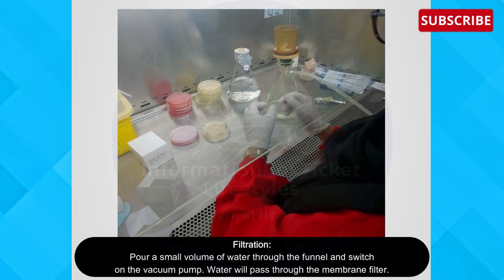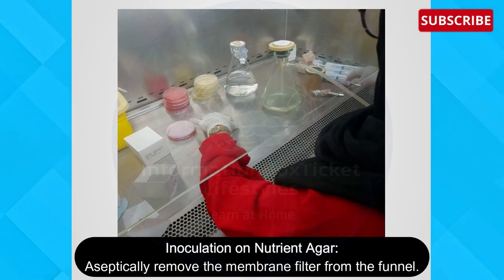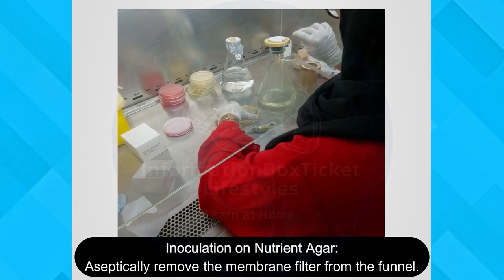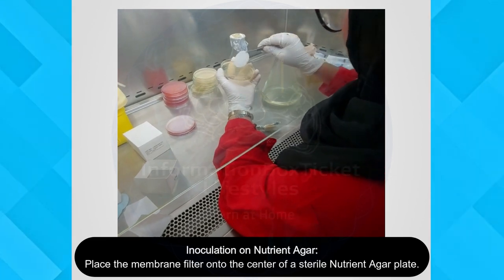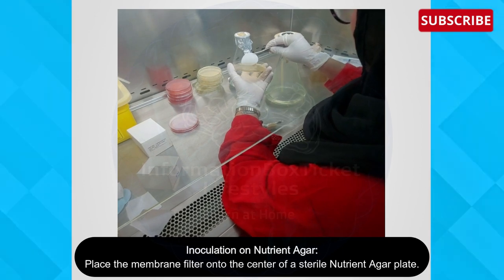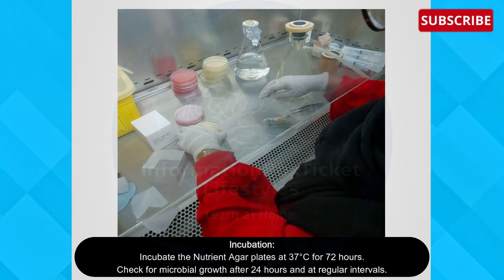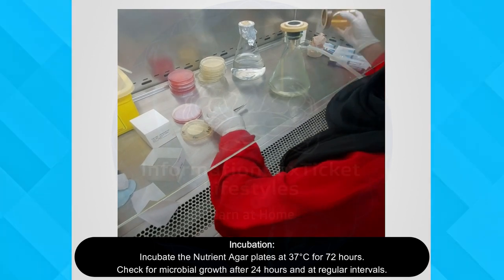When all the water has been passed, aseptically remove the filter funnel and remove the membrane filter from the funnel with the forceps. Make sure the forceps are sterile as well. Place the membrane filter onto the center of a sterile nutrient agar plate, making sure the white part of the membrane filter is placed on top of the nutrient agar. Now, incubate the nutrient agar plates at 37 degrees Celsius for 72 hours.